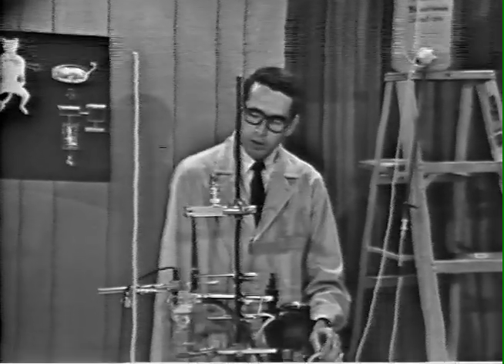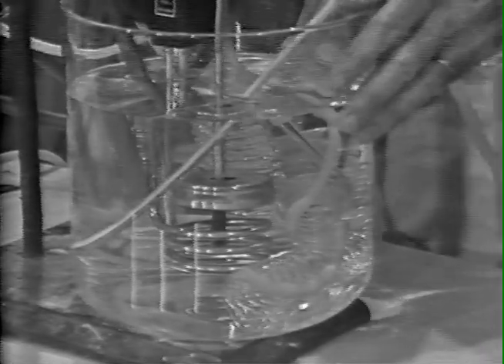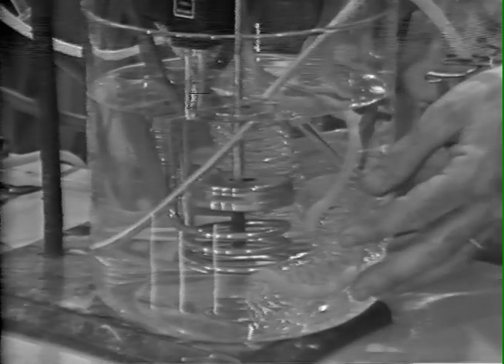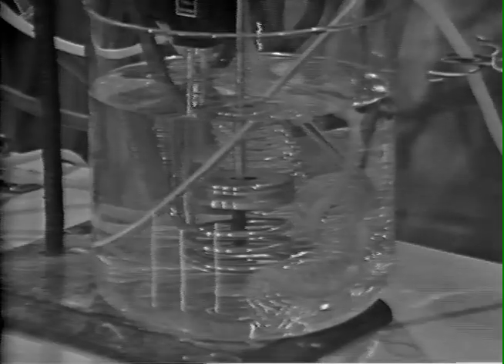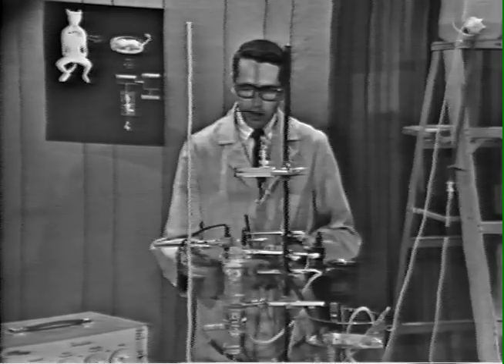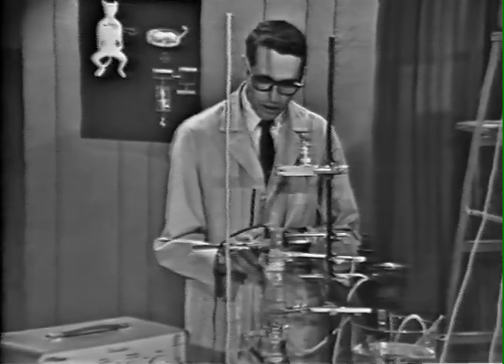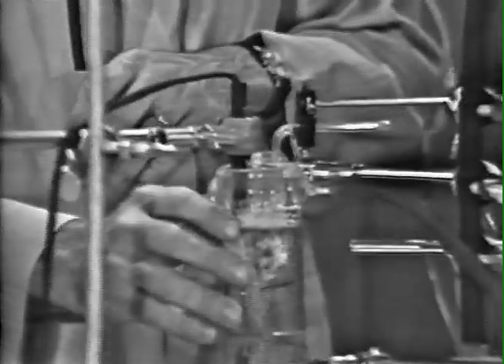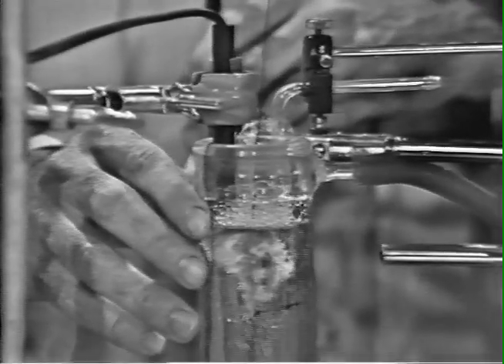Before the fluid flows to the bath, however, it passes through coils which are immersed in a water bath maintained at 37 degrees, so that before the fluid reaches the atrial bath, it is fully equilibrated at this temperature. Now, we are able to add drugs directly into the atrial bath just by injecting them with a syringe and obtain any desired concentration of drug that we wish and obtain the response in this way.